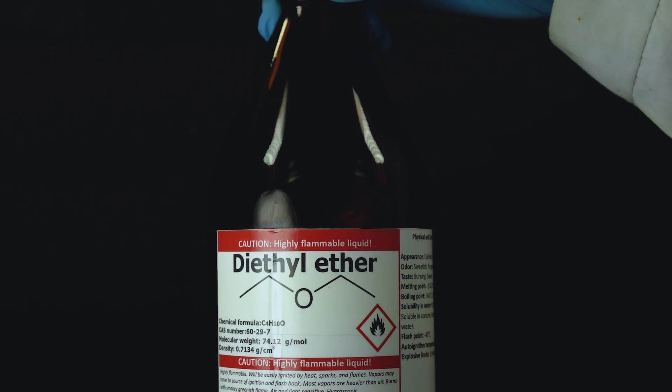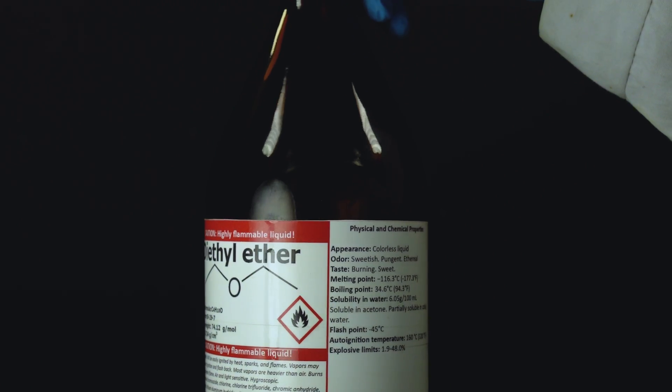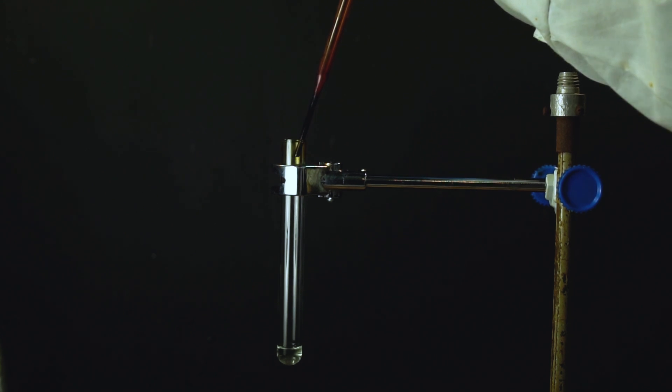A typical reaction of chromyl chloride with benzyl alcohol was demonstrated plenty of times, so I will show a reaction with diethyl ether.